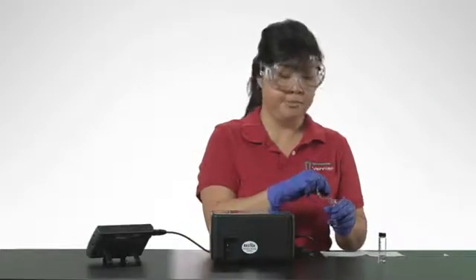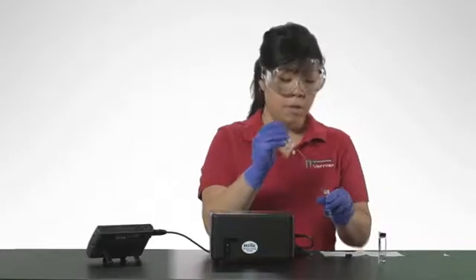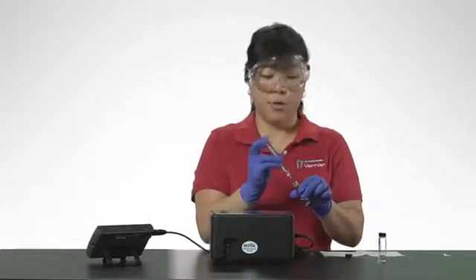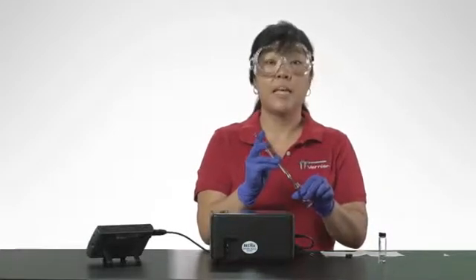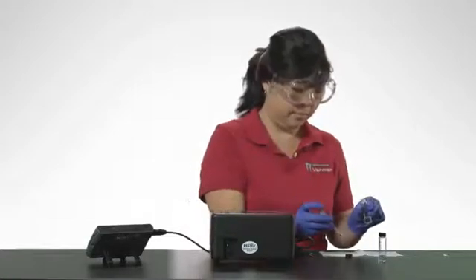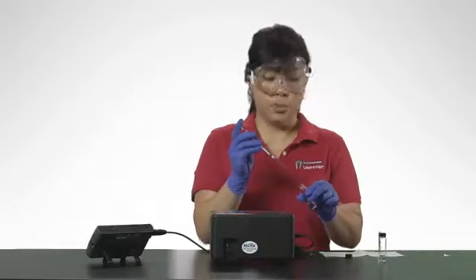Submerge the tip of the needle into the vial containing the sample. Pull back the plunger to fill the barrel about one-third full. Expel the liquid onto a paper towel. Repeat this process two more times.